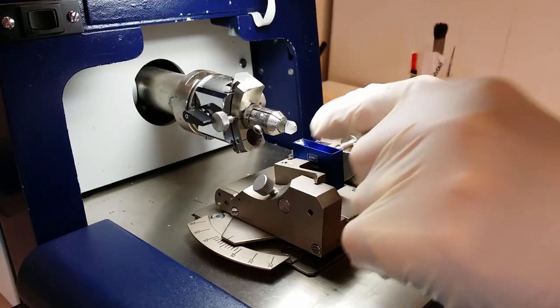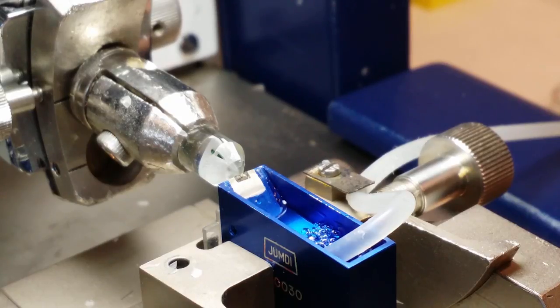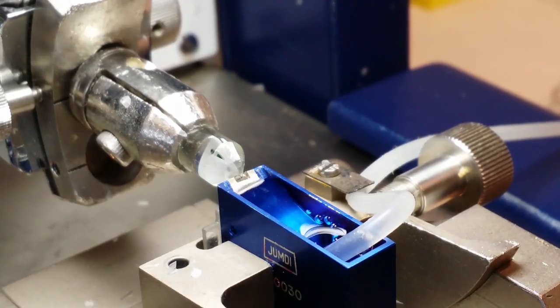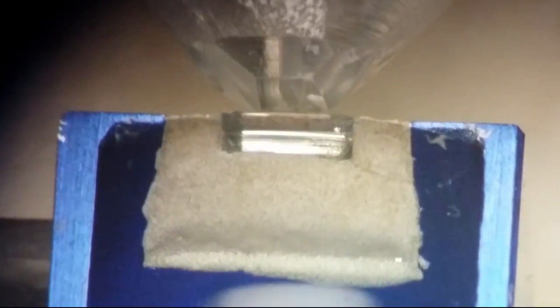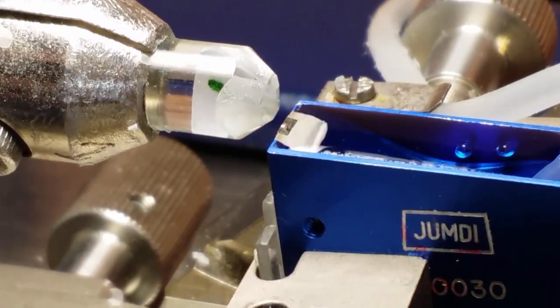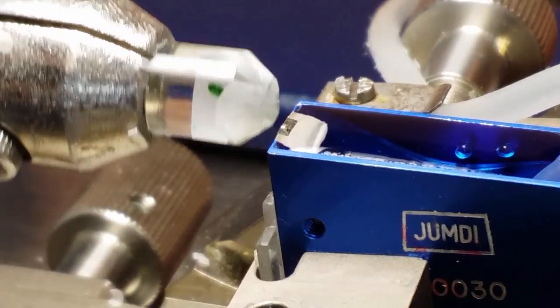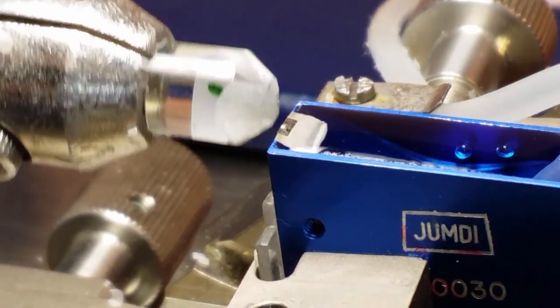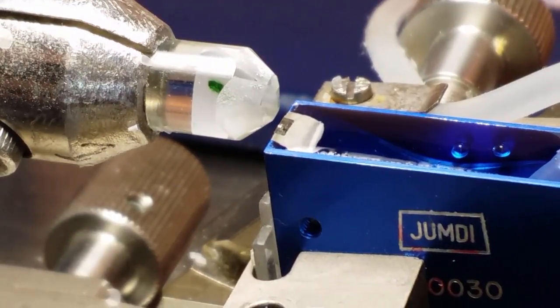Make sure that nothing touches this edge of the knife. So now I have put in the hose here that will fill water in the boat. So now we are going to cut with the diamond knife. Here it is vital that you cut very very thin samples. Otherwise you break the diamond knife. One click on the turning wheel means that it is half a micron. Now it starts to cut.